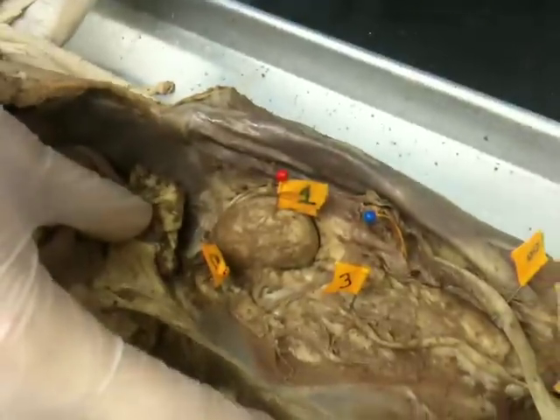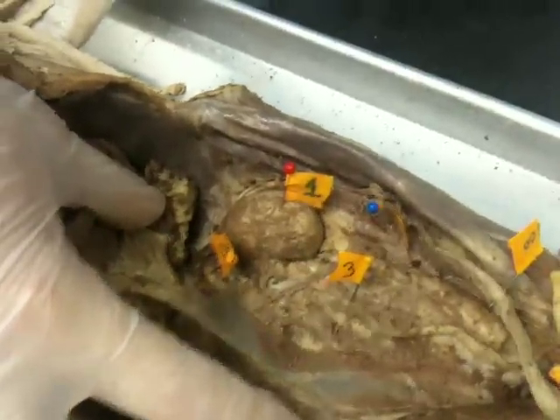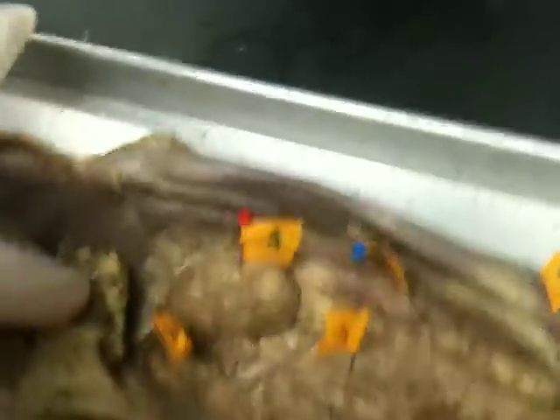This comes from figure 38-5. This is the female reproductive organs and urinary tract.